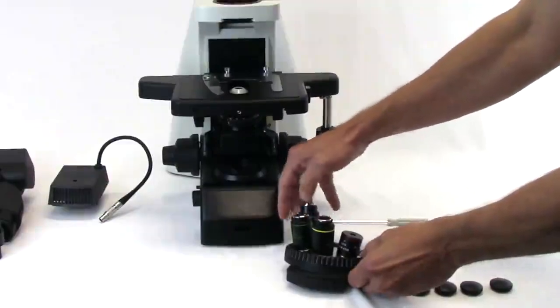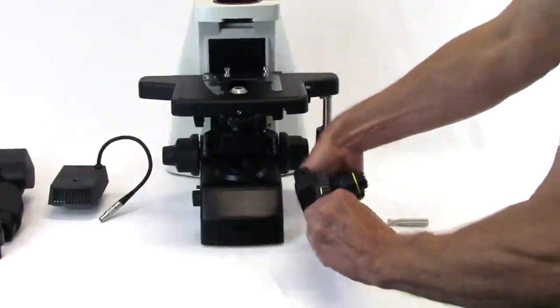Note: never force any objectives onto the threads of the nose piece and do not over-tighten.